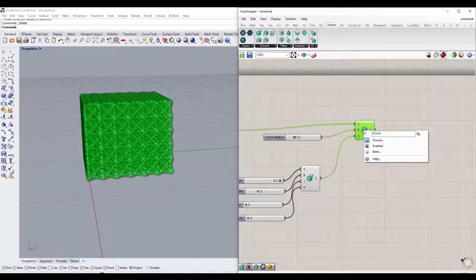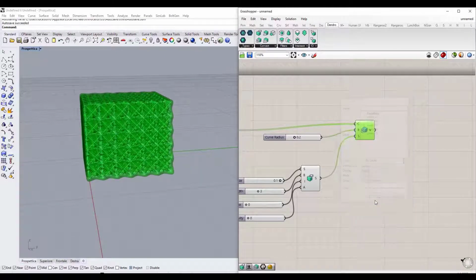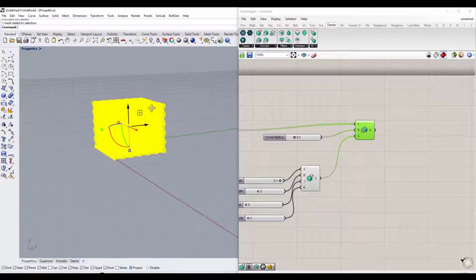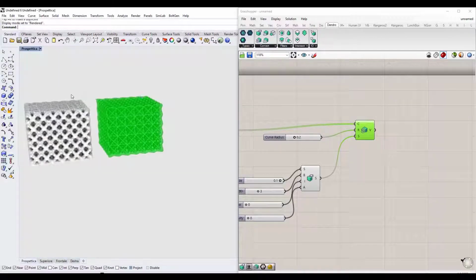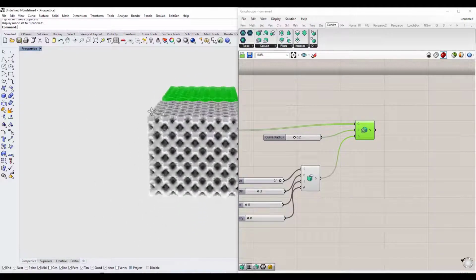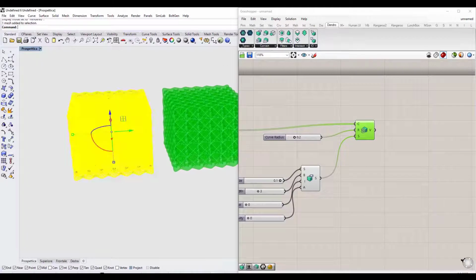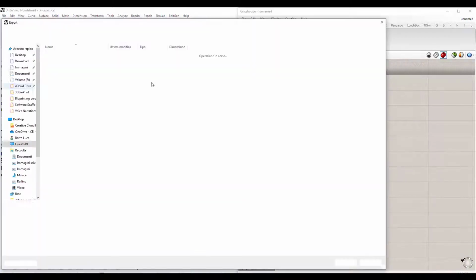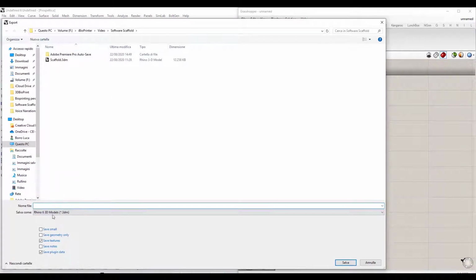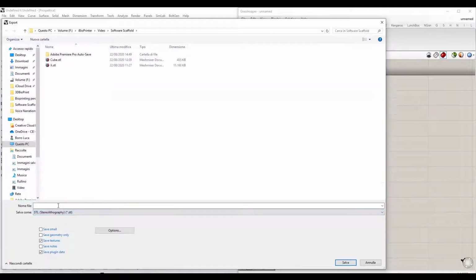Well, to do this, we simply right-click on the last component created and click on Bake. Our 3D model scaffold is now transformed into a mesh. We select the new mesh, click on File, Export selected, and we choose the STL format. Let's give it a name and save it on our computer.